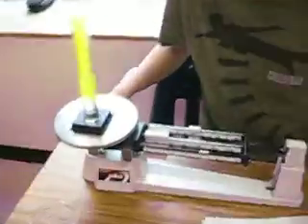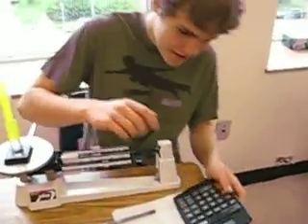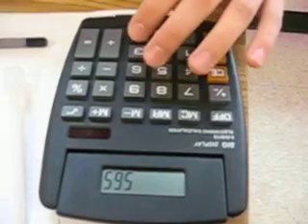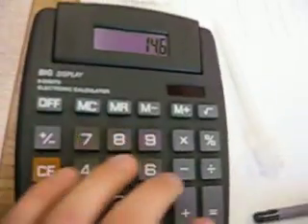Now it's time to do some math work. I'll be back in just a second. Now that we got the calculator for the math, we do our math. We take the mass of the graduated cylinder and the liquid and subtract it from the graduated cylinder. So, 56.5 subtract 14.6 equals 41.9.